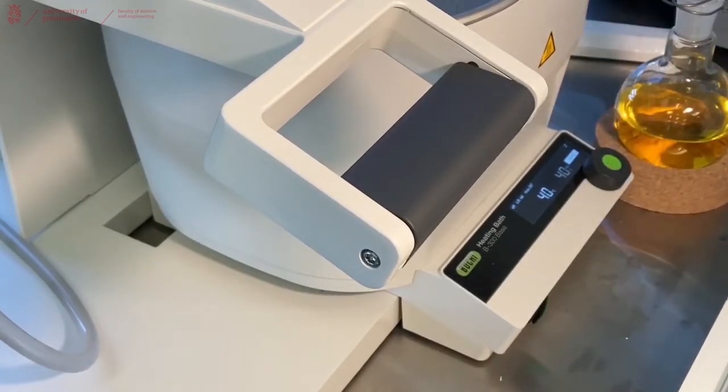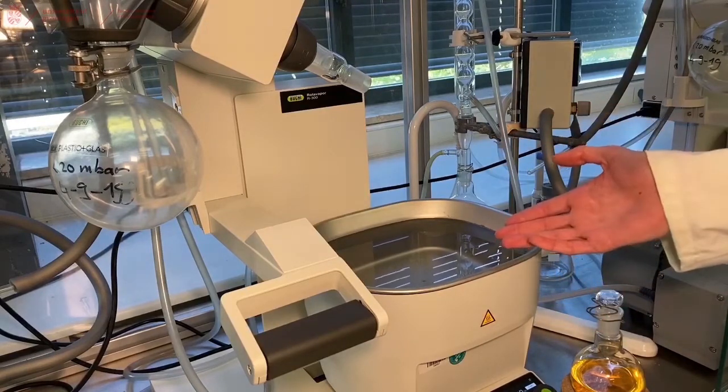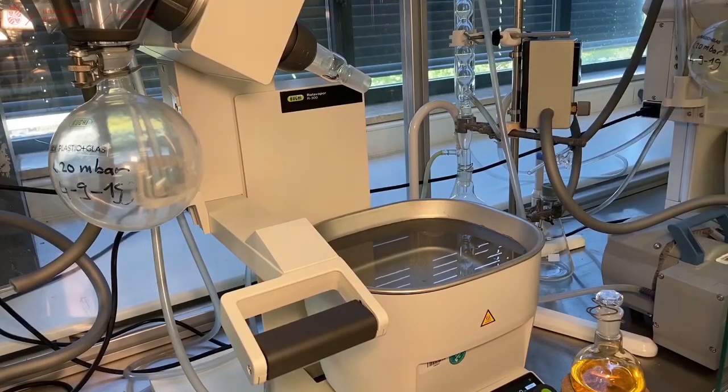And the water bath has to be filled with water. So if there is no water in here, fill it with demi-water from the tap available in your lab.